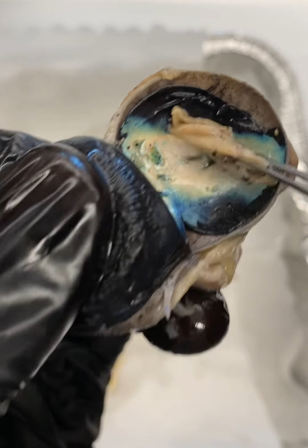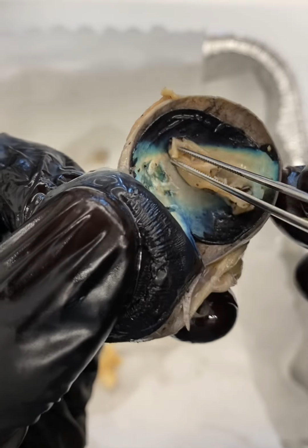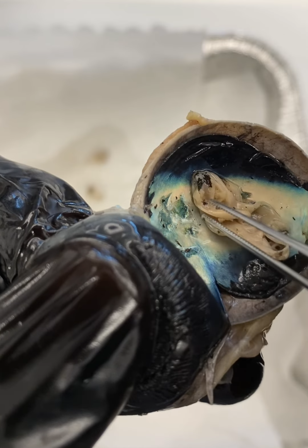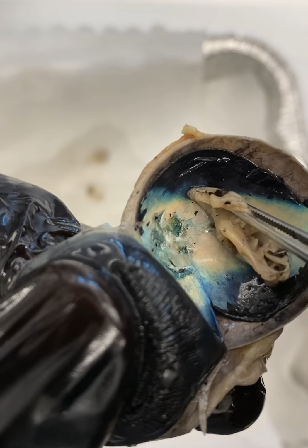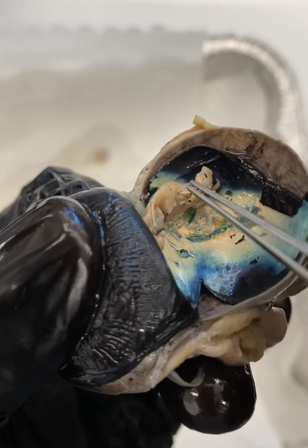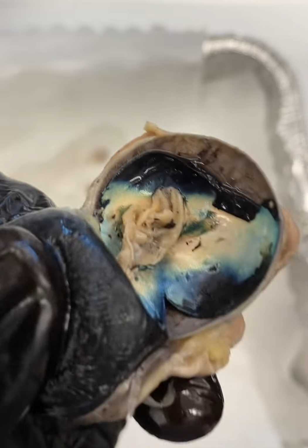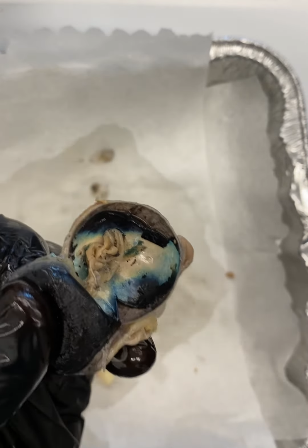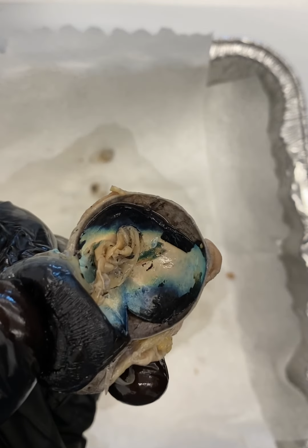All this yellow tissue is retina. At this optic disc, this is where the ganglion cells that make up the innermost layer of the retina are leaving. This is also called our blind spot. The optic disc is our quote-unquote blind spot, and the reason for that is there are no photoreceptors present at the optic disc. Any light that is focused on the optic disc, we are not able to perceive. So this leaves us with a blind spot.